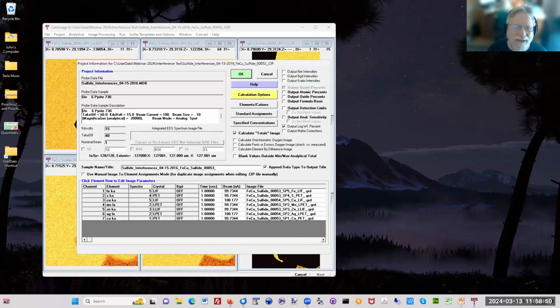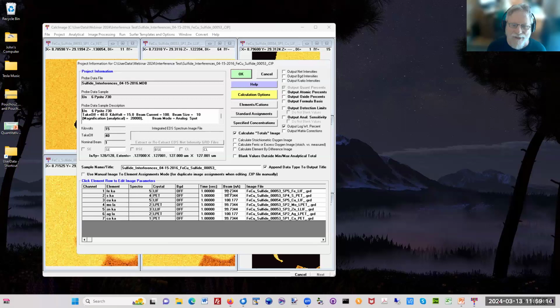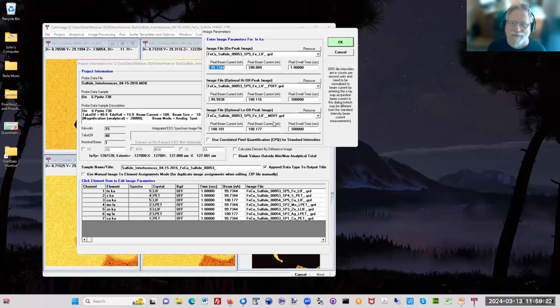Is that correct, Annette? I think, yeah. So it's 50, that's from... yes, but not entirely. That's the unknown that you pulled in. Right. Oftentimes it's different. So your conditions are there, so it's here it is, 100. So it's 100 nanoamps right here. In fact, when you click on each of these elements here, you'll see the map exactly used for the background, the plus and minus background.